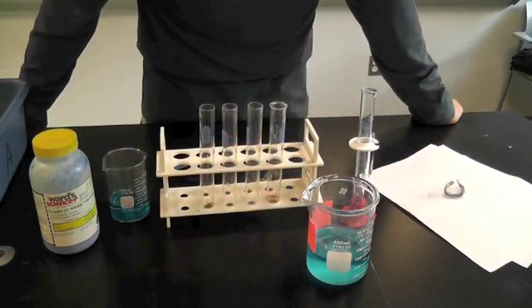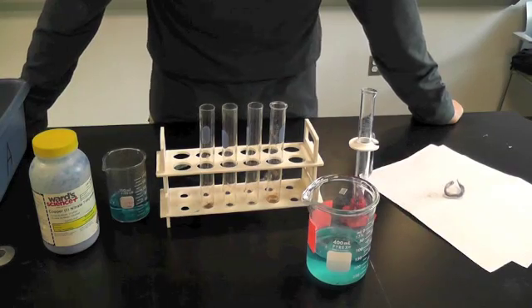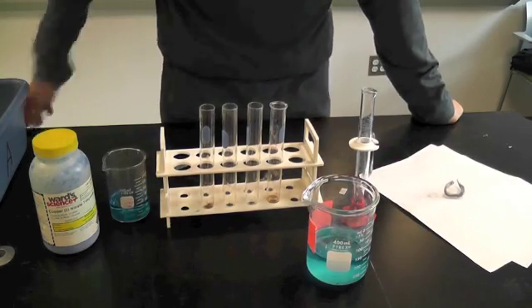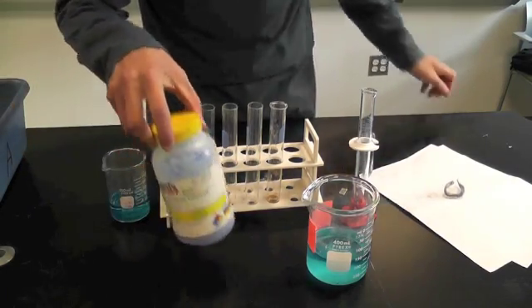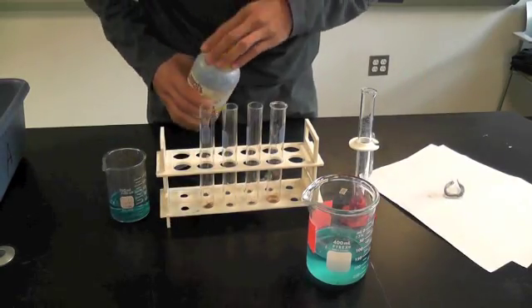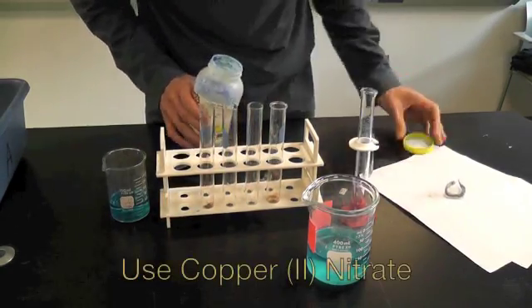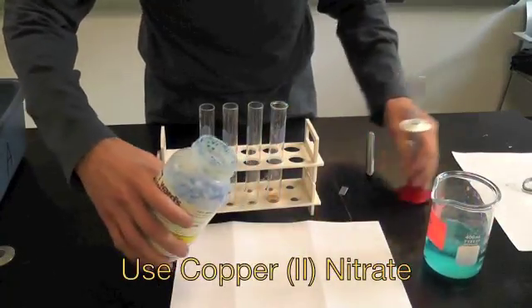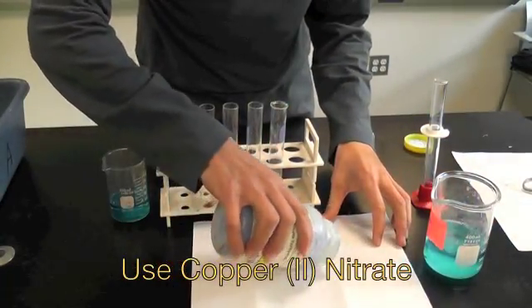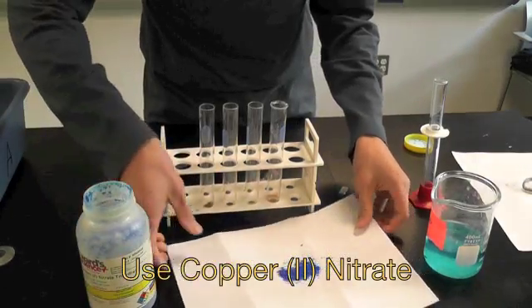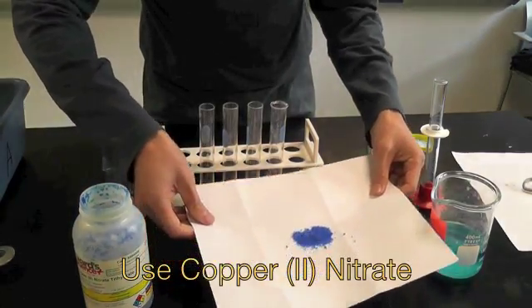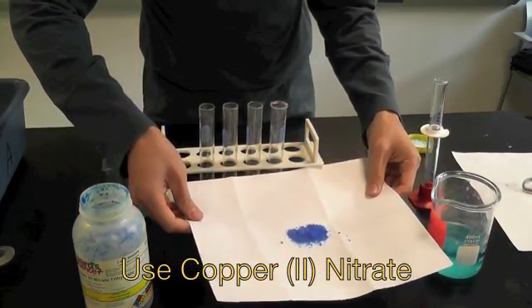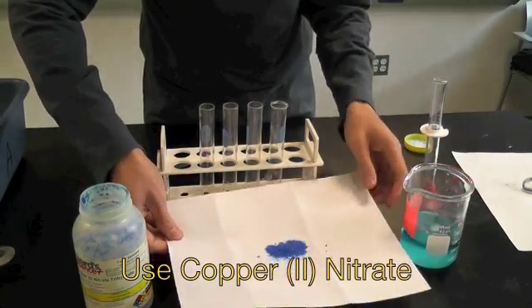The first reaction we're going to do involves a copper solution. We're going to start with copper nitrate, and here we have some copper nitrate, and it does have that characteristic blue color for a copper compound. So you can see here, here's some copper nitrate right here. It does have that characteristic blue color.